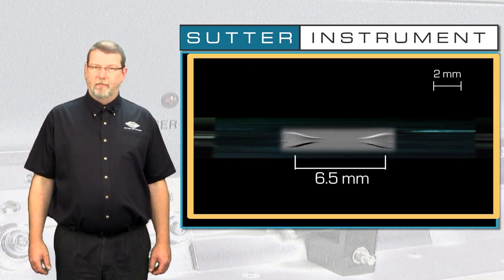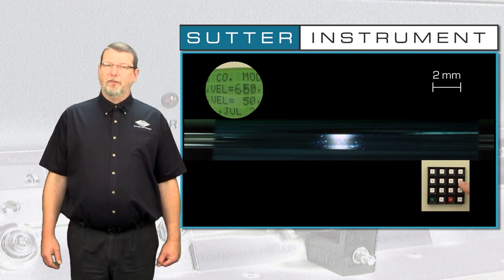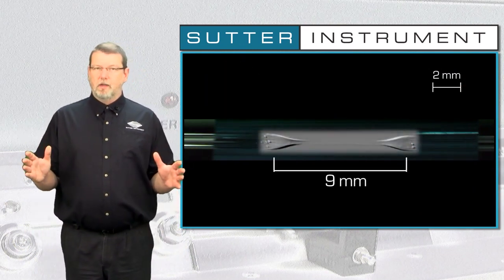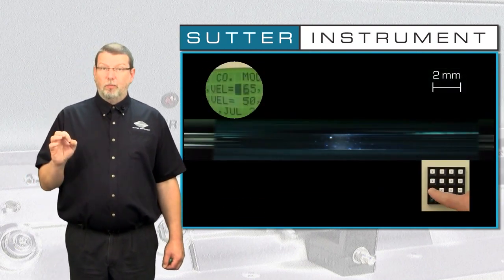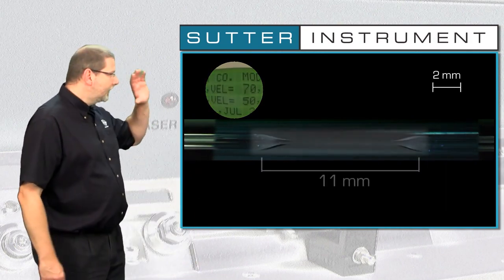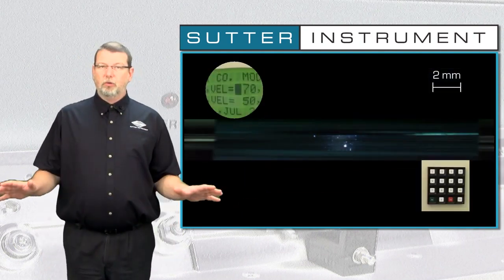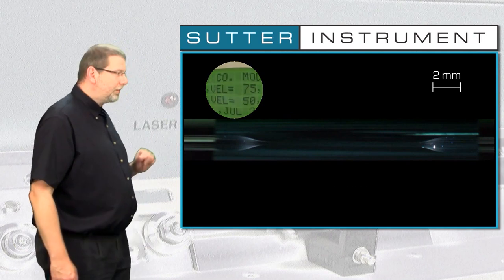Our goal is to find out whether there's a linear relationship between the velocity and the length of the hourglass. One important point I would like you to take home today is that we can confidently state the relationship: higher velocity equals longer taper. However, I would not like you to think that for any type of patch pipette you should just use velocity 55. 55 is the ideal velocity for this particular program and that type of glass. But different conditions require different values. With that, back to our patch pipette project.